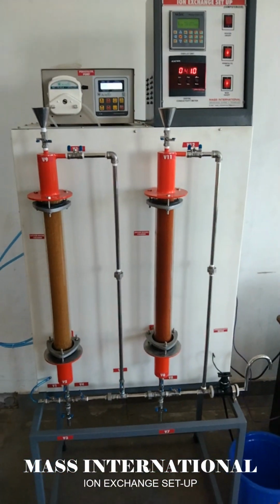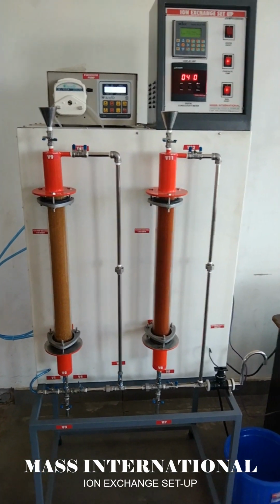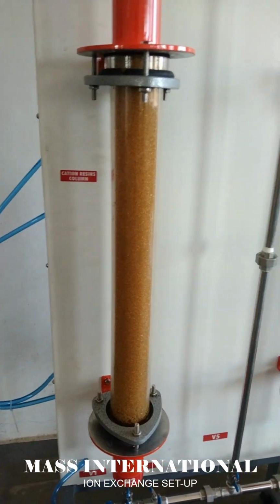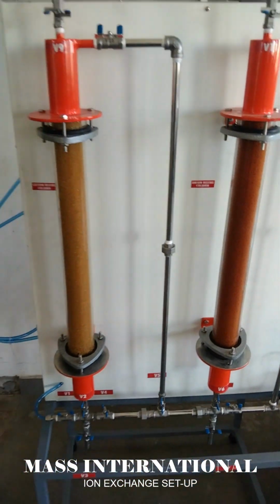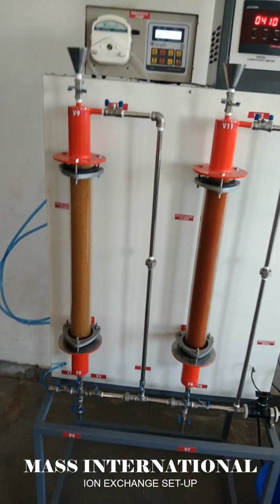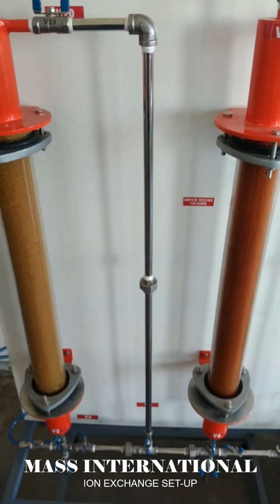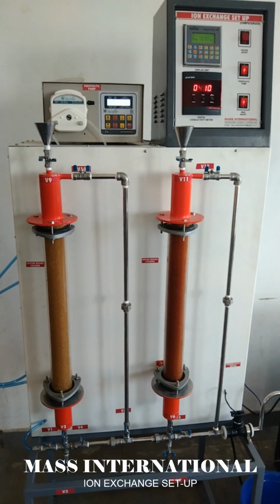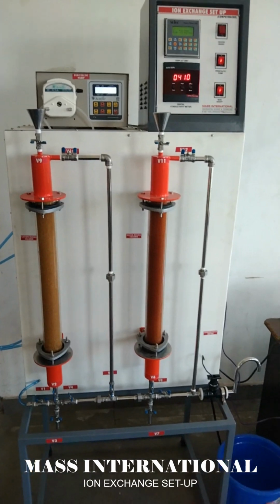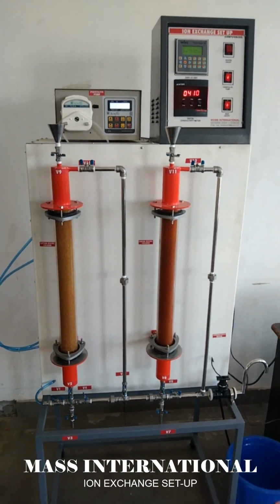This is a data logging apparatus in which there are two columns fixed in front of the panel. One is a cation column and another is an anion column. Both the columns are filled with resins, cation resin as well as anion resin. You can perform different experiments with the cation and anion separately, as well as with cation and anion both in combination.